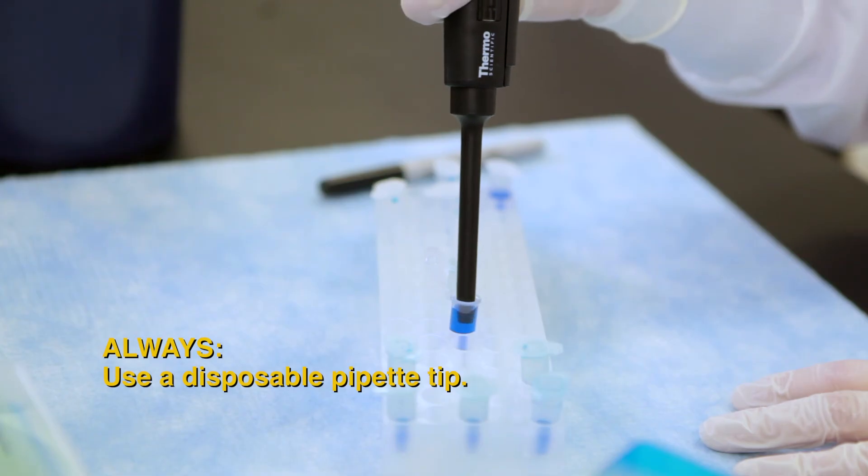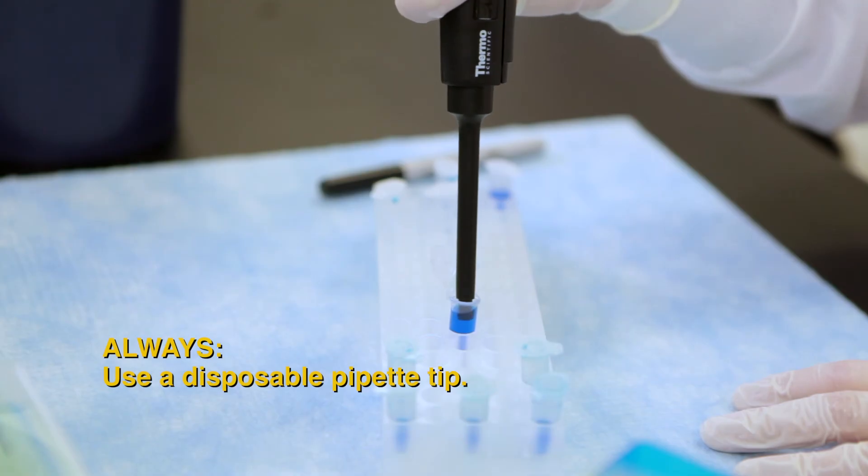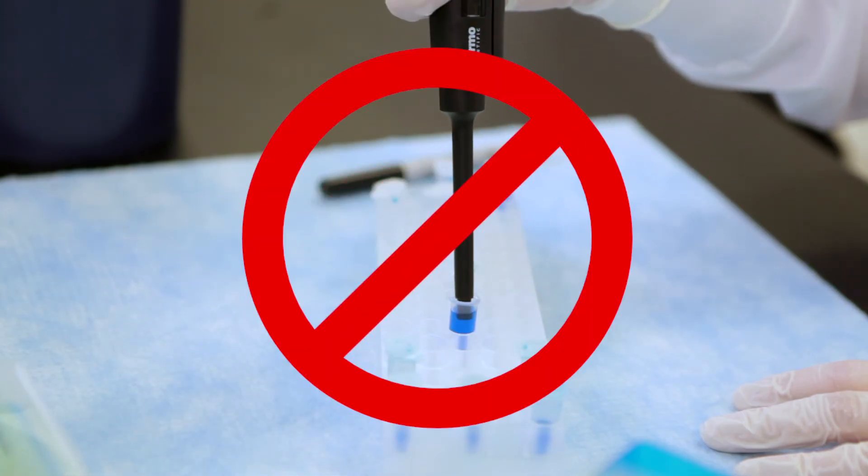Do not use a pipette that does not have a tip attached. Liquids should never enter the body of the pipette. It will cause pipette corrosion and be a major source of contamination.